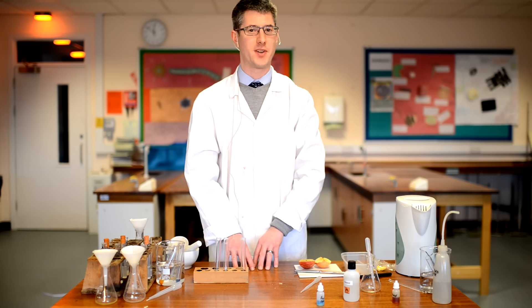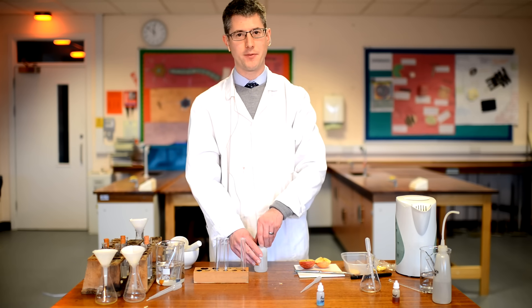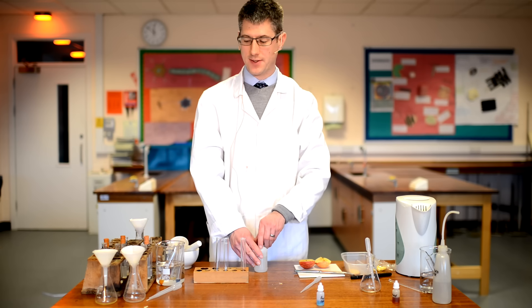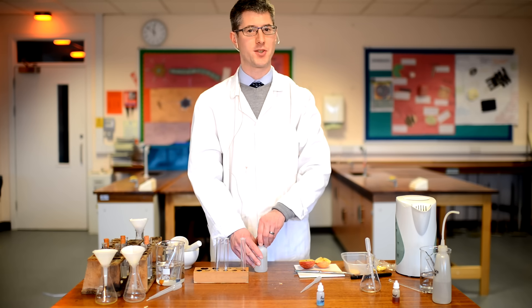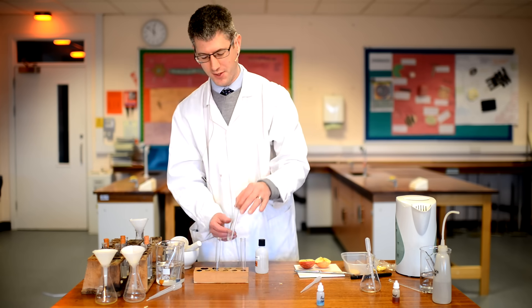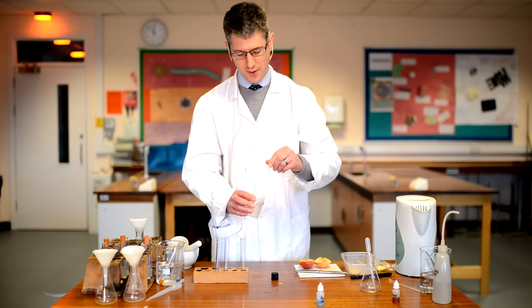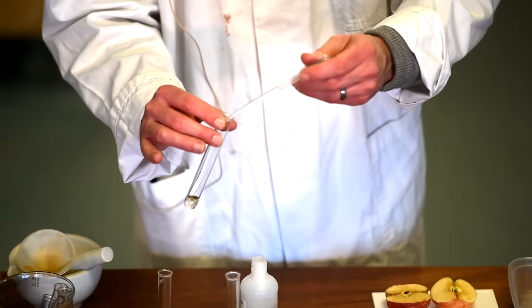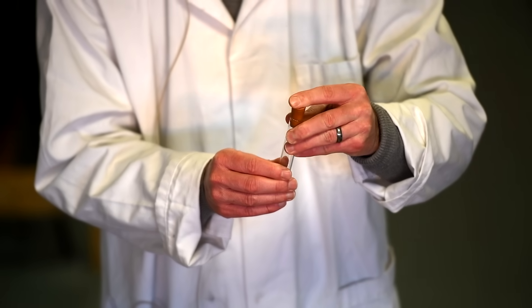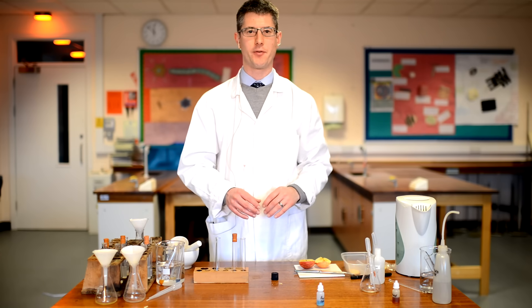The third test is a test for lipids or fats, and it involves using ethanol. The AQA method asks you to grind up some food, add some distilled water, and not filter it — just test the food sample with water together. That works fine, but since you've already made a filtered sample, you can just use that, which saves a little bit of work. So we add distilled water to our sample, and then add a few drops of ethanol. Having added the distilled water and the ethanol, you now need to shake vigorously — place a bung in the top of the tube to prevent any accidents and give it a really good shake.